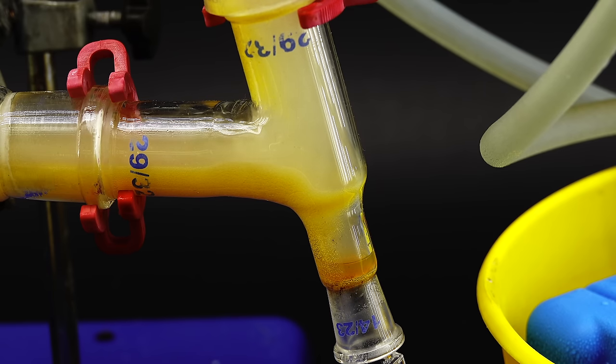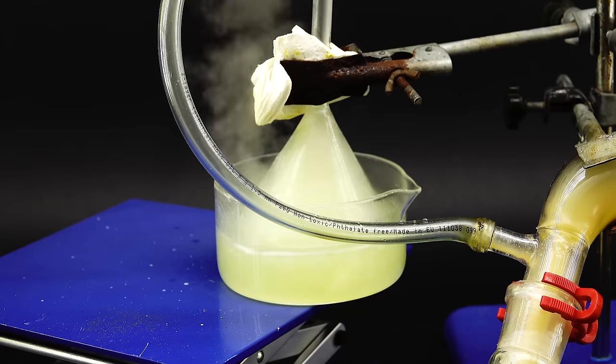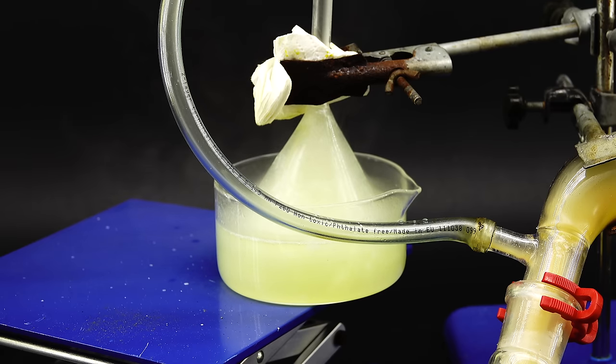After about 10 minutes of heating the silicon I started to see a tiny amount of an orange liquid accumulating near the collection flask which told me that the process was working but just from the look of the trap I was sure that I was going to lose a ton of my product due to it being surprisingly volatile and hard to condense. Also, quite an interesting detail is that some of the silicon started to glow red on its own from the reaction with chlorine but I still helped it using my blowtorch to ensure a more complete reaction.